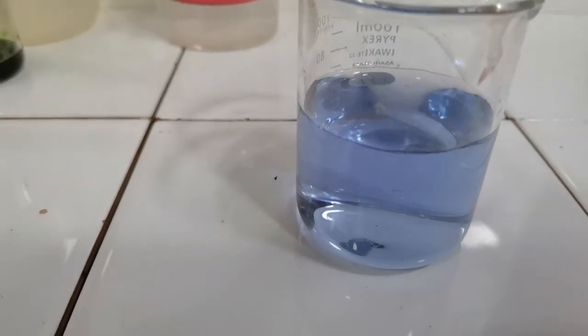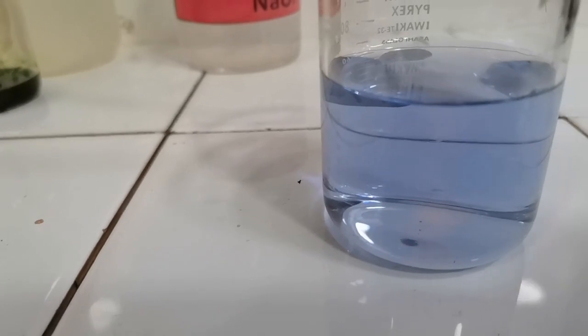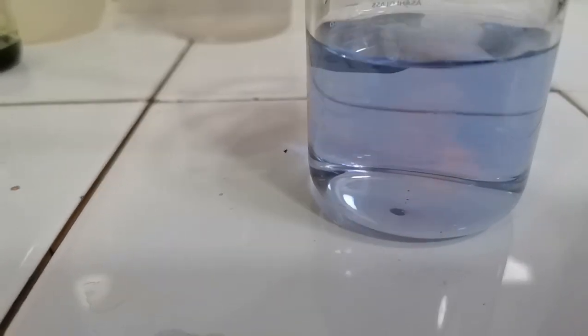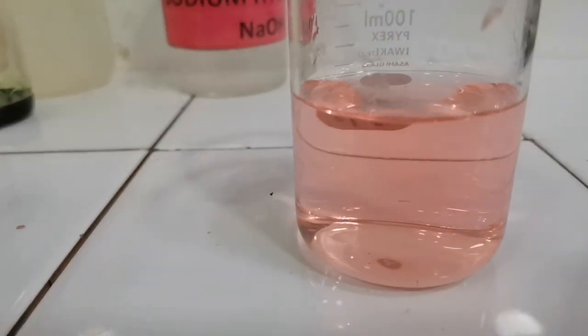Repeating with sulfuric acid, we have a drop of sulfuric acid being added, and we have to observe the color change carefully. The sulfuric acid has gone to the bottom, so the solution at the bottom has a slight red tinge to it. Added another drop, turned it more red. Adding another drop, turned it even more red. Now let's shake the contents of the beaker. The entire solution turns pink again.